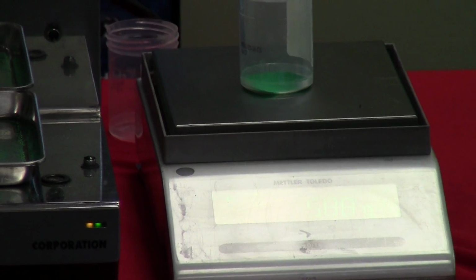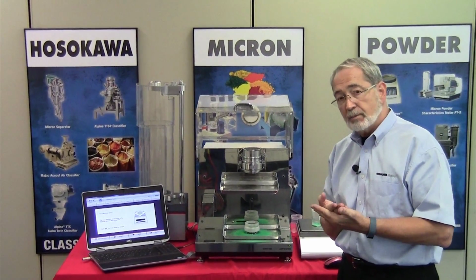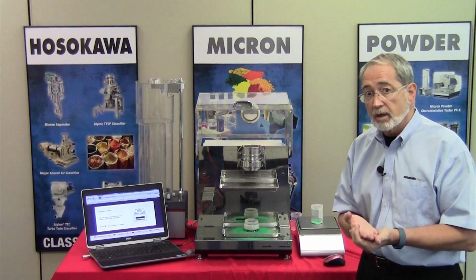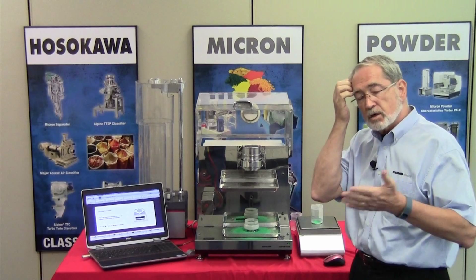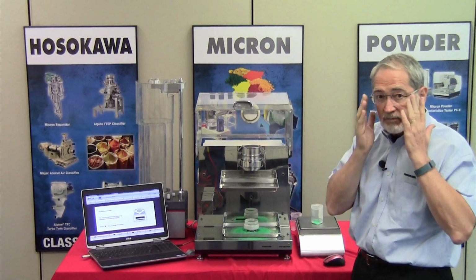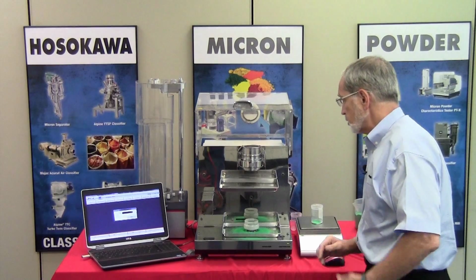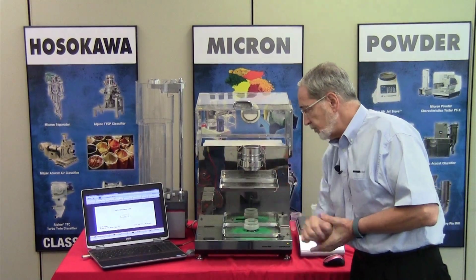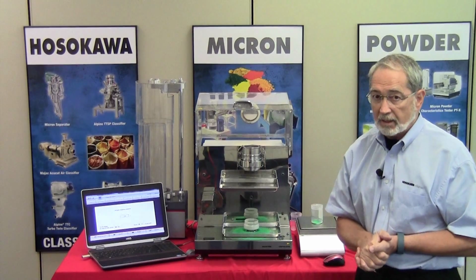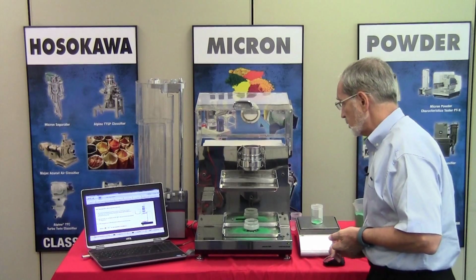We got 5.88 grams. Now, in accordance with the official Carr paper, it's a 2-gram sample. However, because of the mathematics, due to the electronics and the software and et cetera, we can actually vary the sample. So what we'll do is we'll press next. And notice it's going to stabilize at 5.88, and it gives you a confirmation that you're dealing with 5.88 grams. All right, so we'll press next to proceed.